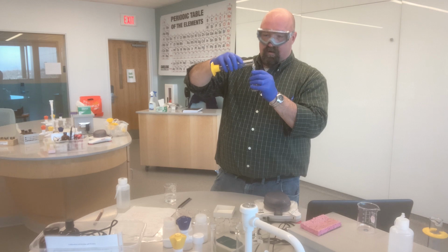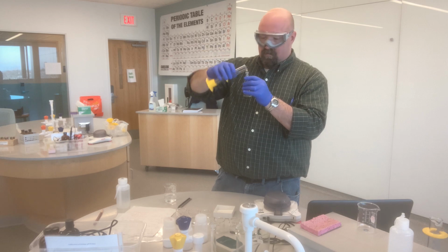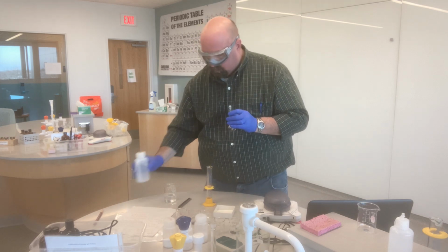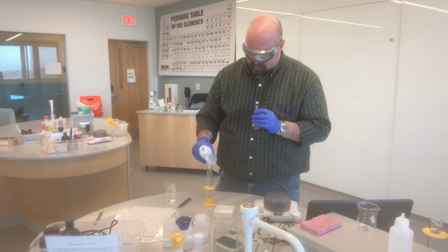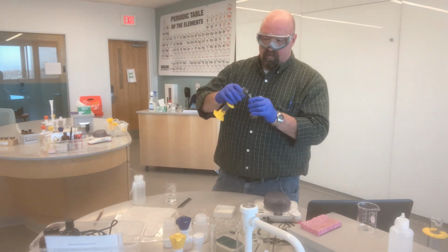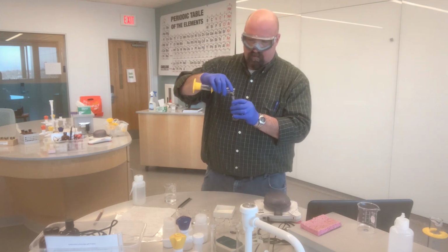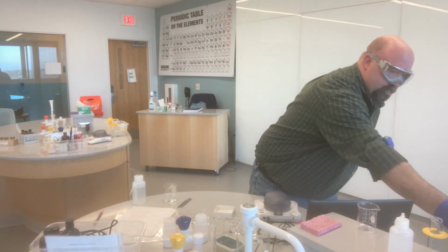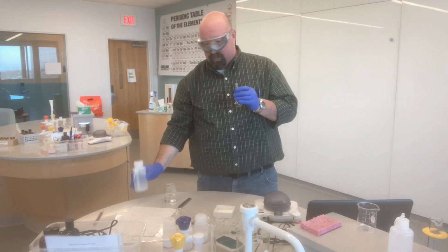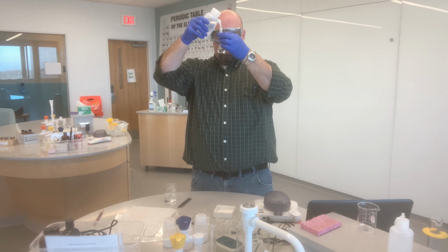Pour that 10 milliliters into my volumetric flask. Rinsing out my graduated cylinder. And finally, fill up to the 25 milliliter line.